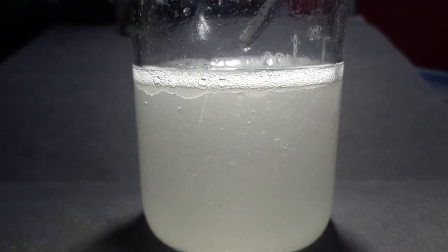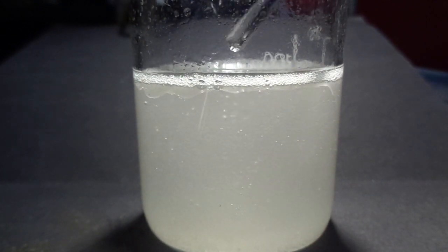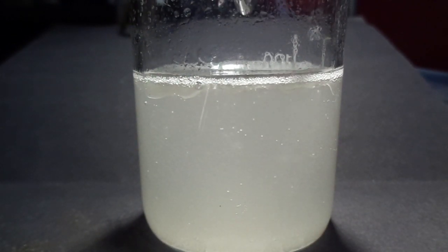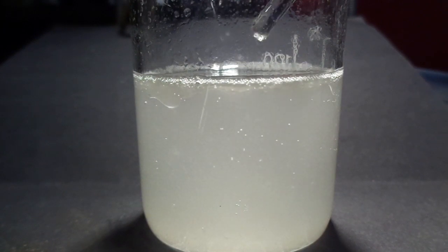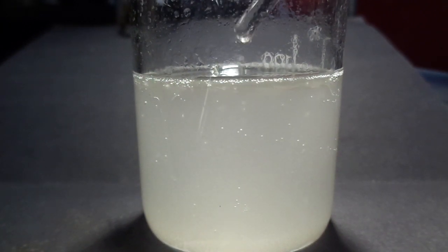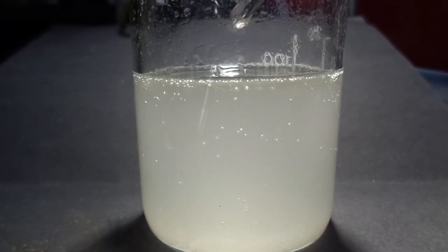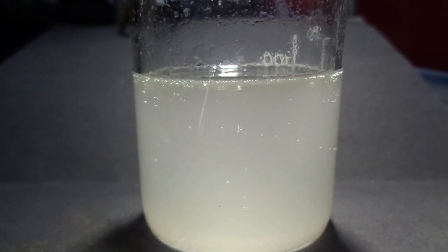So I actually can see some bubbles forming at the bottom, which are most likely our product, which is really nice. I hope we are going to have nice layer separation.